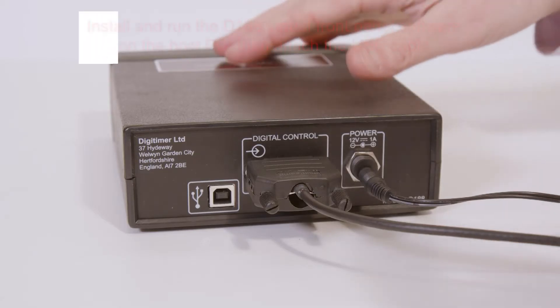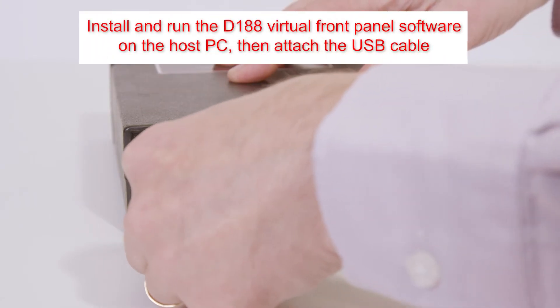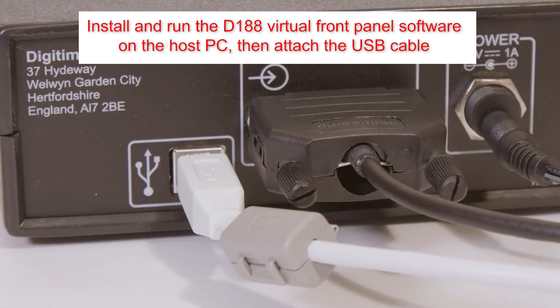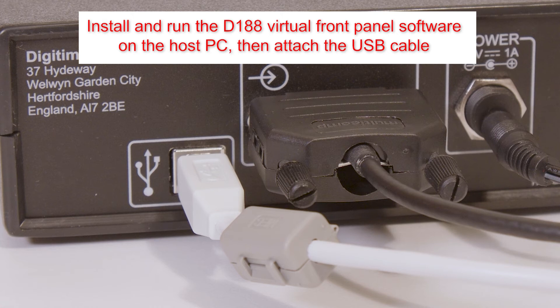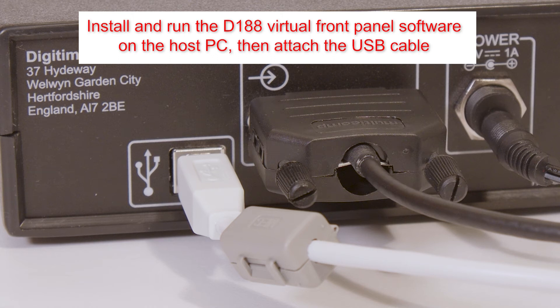The supplied USB cable allows the D188 to be controlled by our Windows compatible virtual front panel software. Install and run this software, then connect the USB cable between the host PC and the D188.